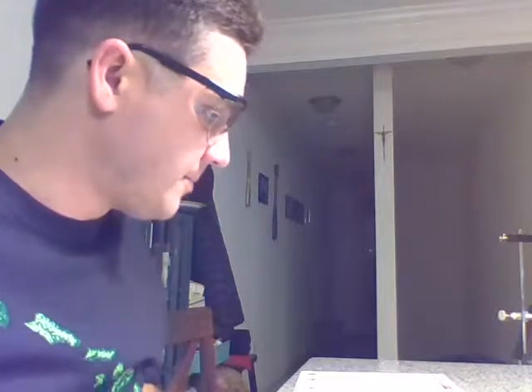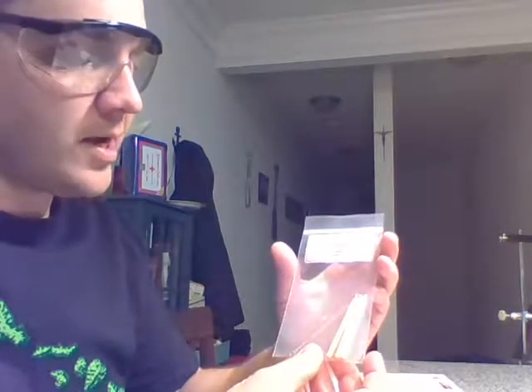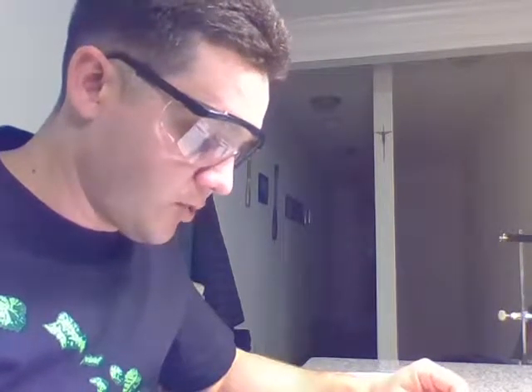Okay, so anyways, my lab setup, I just used the procedure for Experiment 1 of Lab 6, and you go through this. Here's my 3 birthday candles and my inoculating loops. There's 3 inside, or 4 inside there. I also have my 5 milliliters of, and I'll go in the order. If you go to step 3 in the lab, it says place in order the lithium chloride, sodium chloride, the potassium chloride, and the calcium chloride. And I have set it up here in that order in front of me so I don't mess this up.